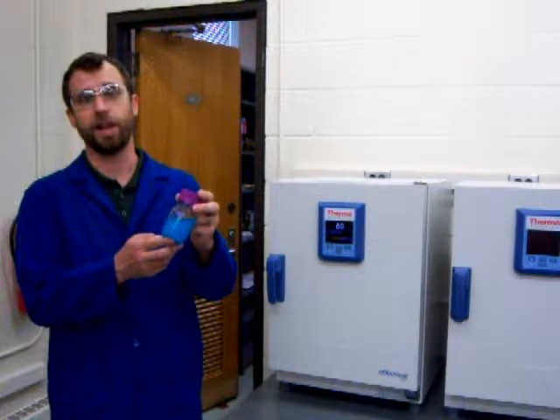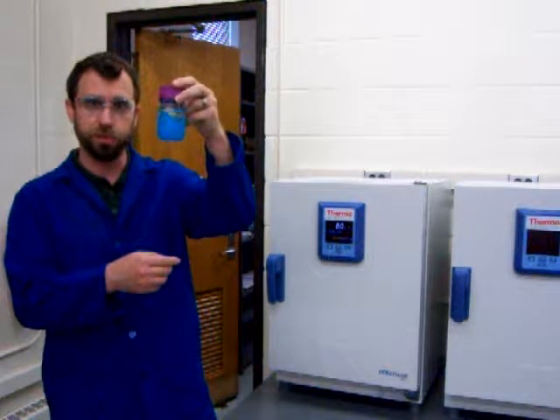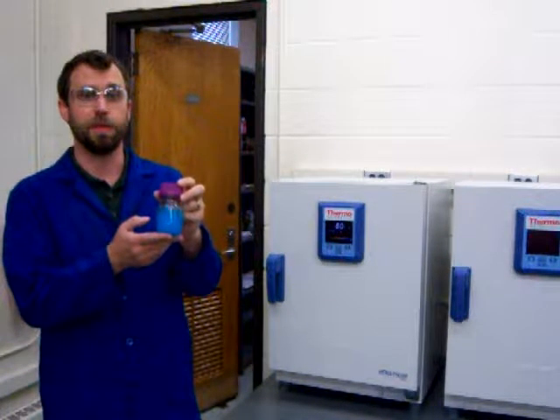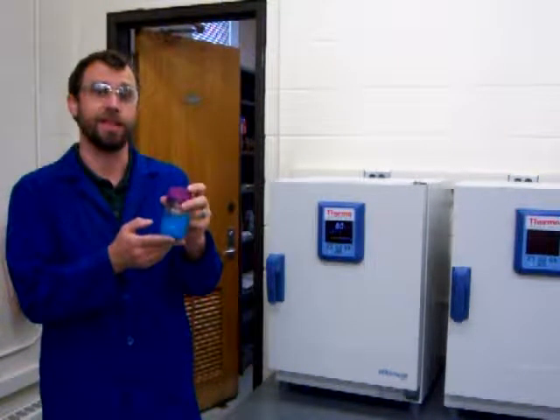Okay, we're back. So now, after stirring our jar for about 5 or 10 minutes, you can see that we have a homogeneous blue suspension. And so now we need to heat this reaction mixture to 85 degrees C, or 185 degrees Fahrenheit, in order for the organic and inorganic components to come together and form the solid metal-organic framework. So in order to heat this jar, we're going to use an oven.